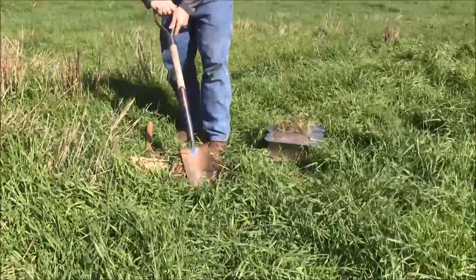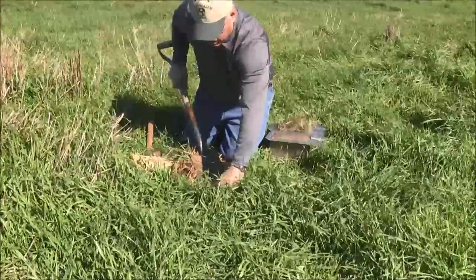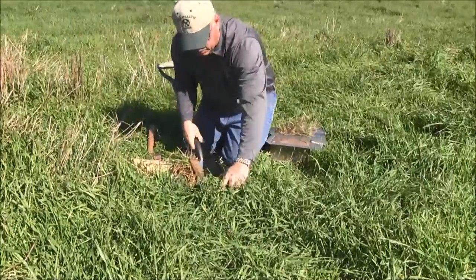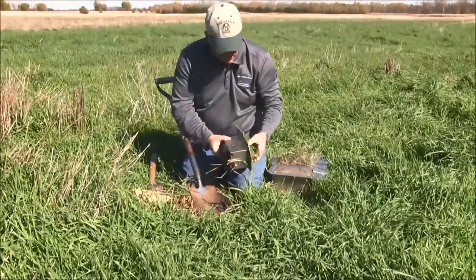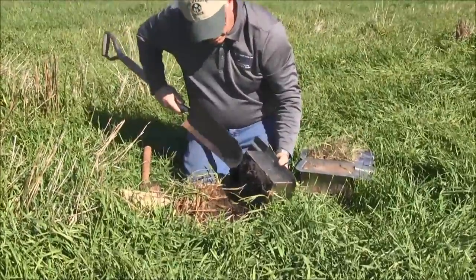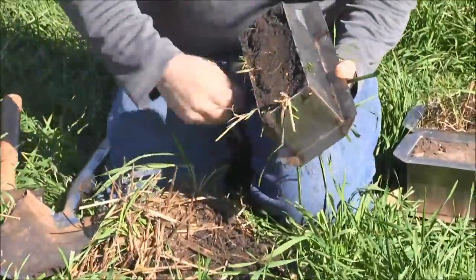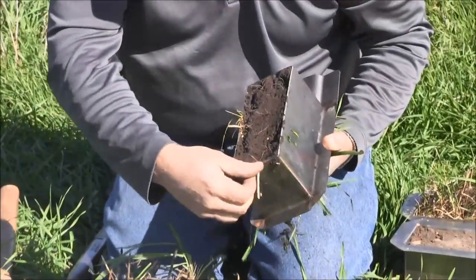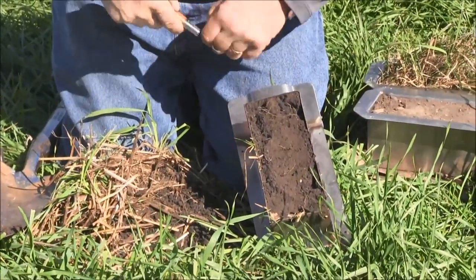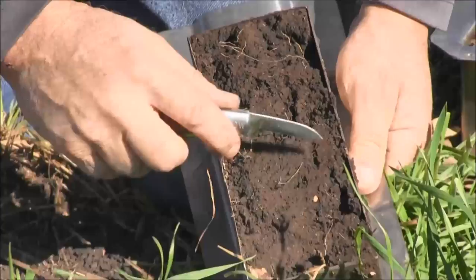Coming out underneath that cutter. In this particular case, we don't have to cover anything. We've got good residue cover and good structure because of that rye. And again, just as we were in that pasture type situation, that root development — we've got our soil hanging on the bottom of that. We can go through and shear that off to the bottom. We did end up a little hairpinning along the edge, but that shouldn't really bother us too much. If we take our knife and pick it a little bit at the bottom, making sure that our macropores are open to the bottom, we should have really good infiltration with this sample.